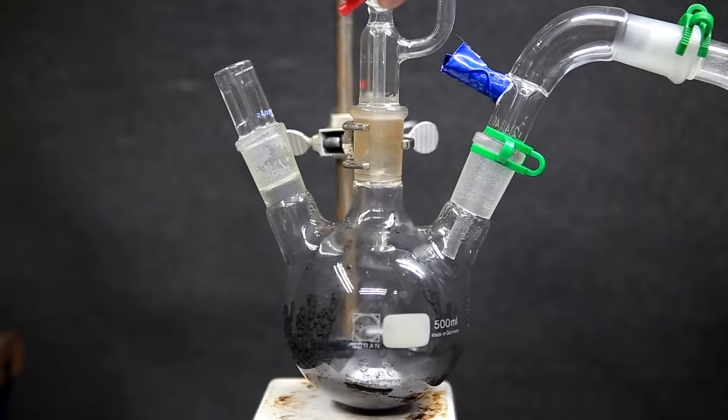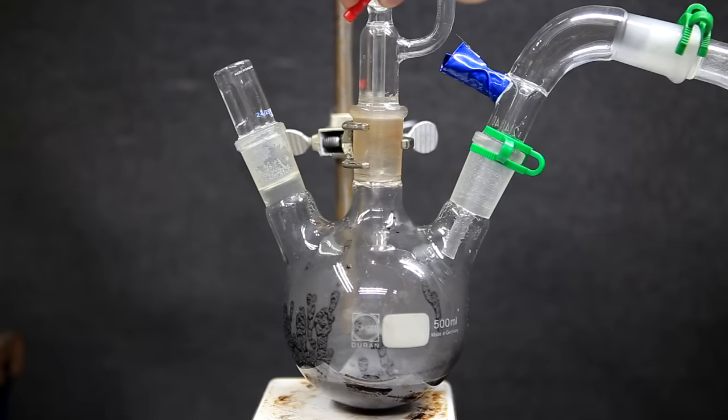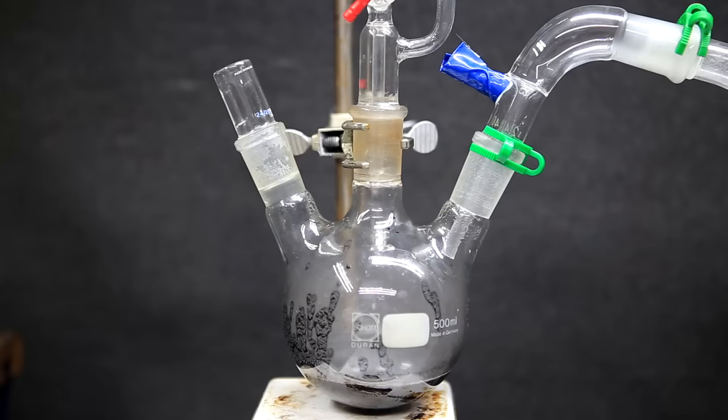So now we're ready and we can start generating our oxygen. The hydrogen peroxide is dripped in and you can immediately see that a reaction is occurring. It's important to use a lower concentration of hydrogen peroxide so that your reaction flask doesn't get too hot.